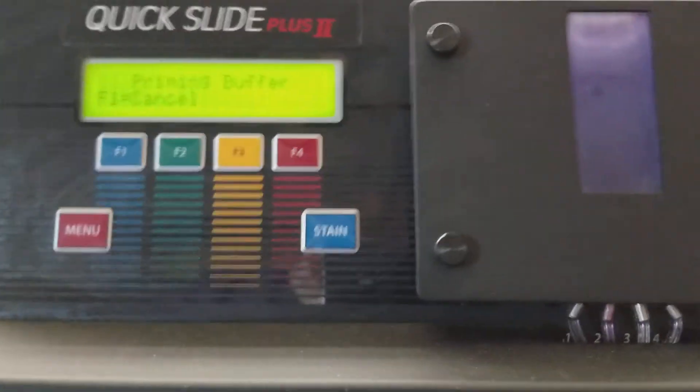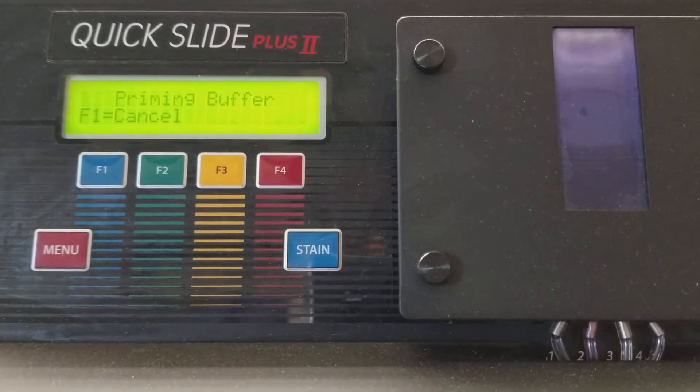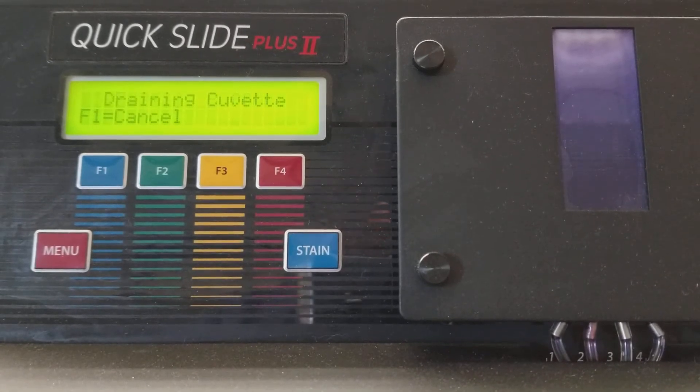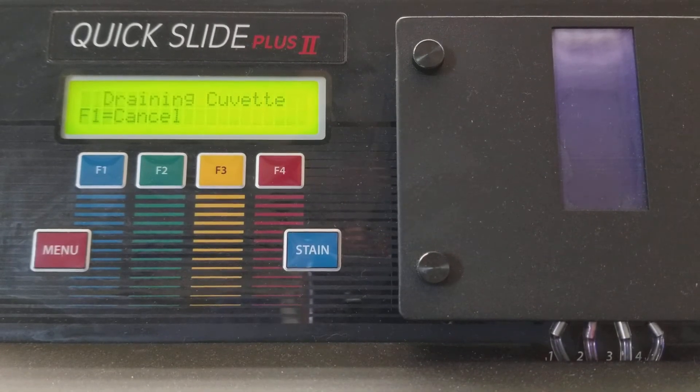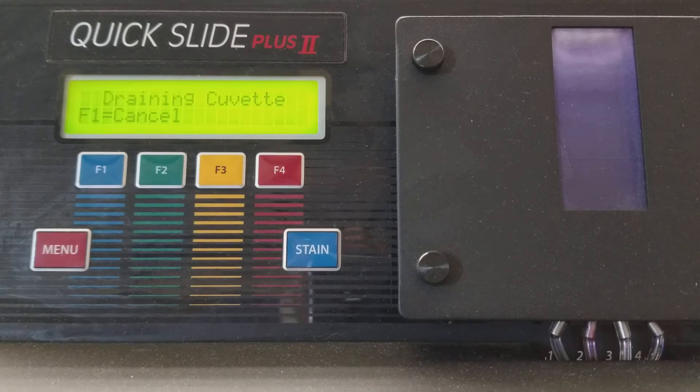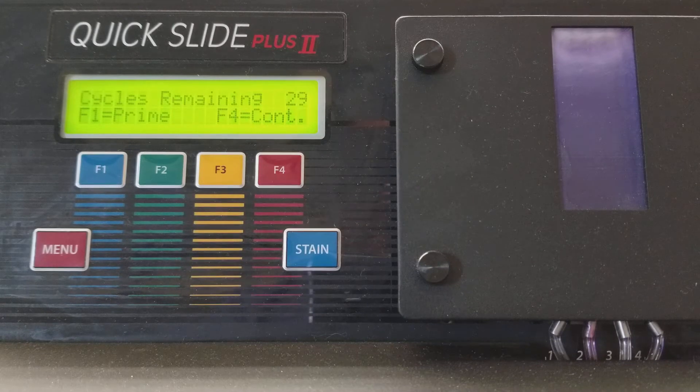Make sure you tell your professor when it's full. So it's still draining the cuvette and priming everything and I'll get back to you when it's done.